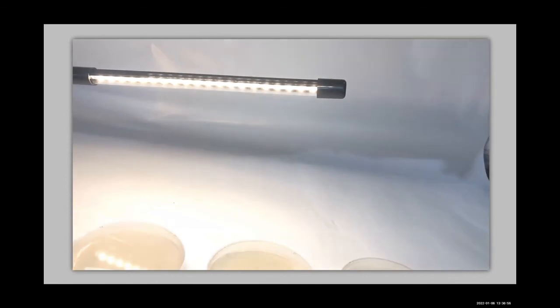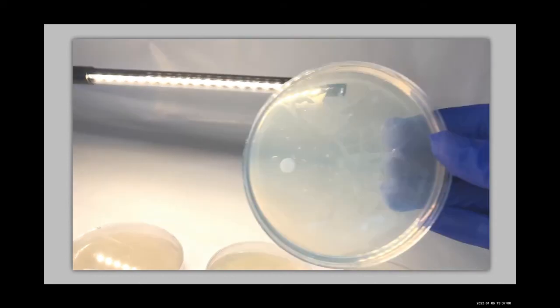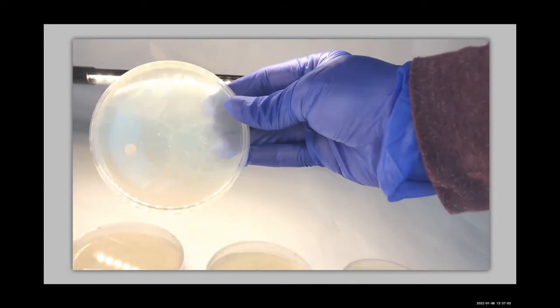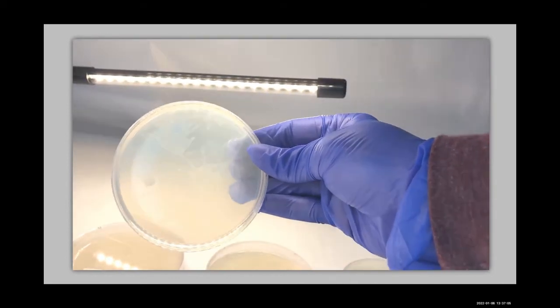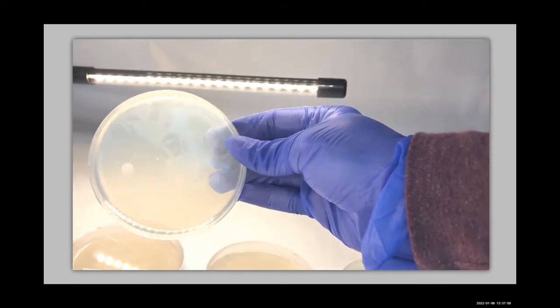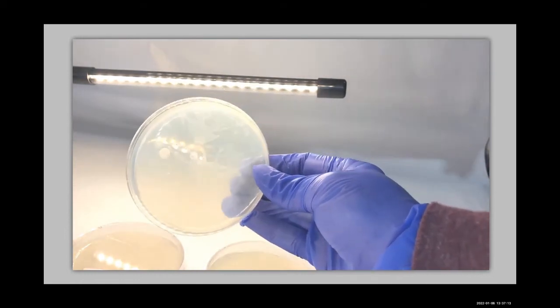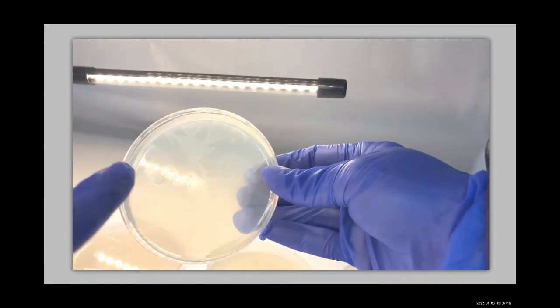And then let's try our staph exposed to our cephalexin. Again, what are we looking for? Clearing. Do we see one? I see another really big one. You can see right there where the margin, you can really clearly see this margin right here.